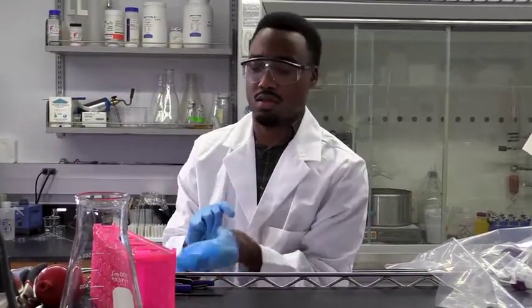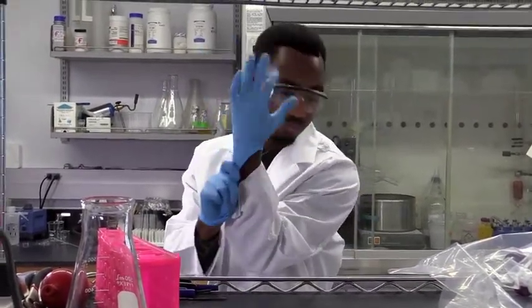When we move from a BSL 1 to a BSL 2 lab, we start putting more safety measures in place, such as an autoclave. And we start providing more training to the employees. And as we escalate to level 3, we add in more PPE and more security. And then finally the highest level, BSL 4, which we do not do at this institution, would have the highest level of security and safety precautions.